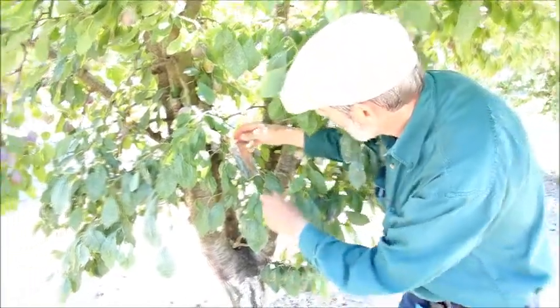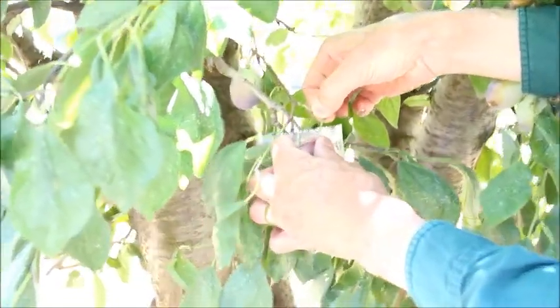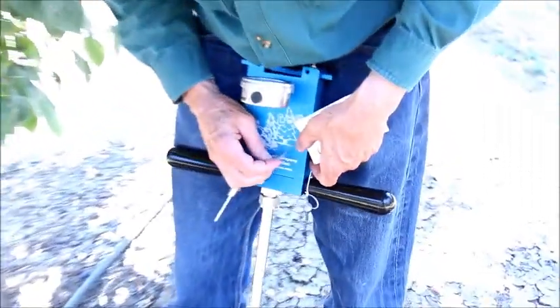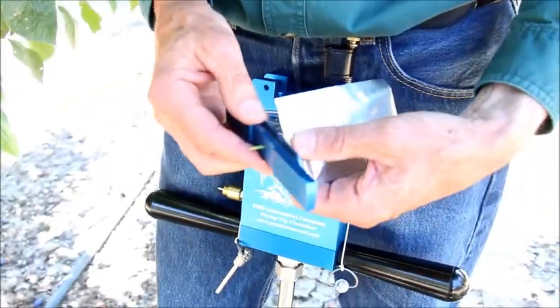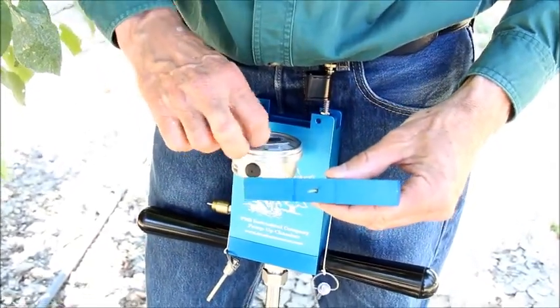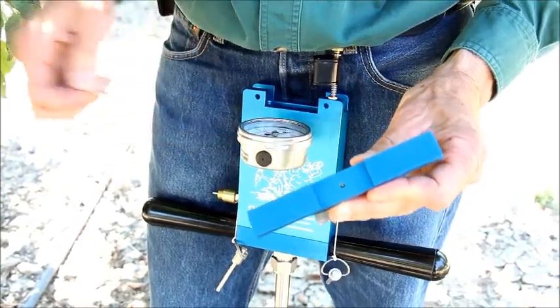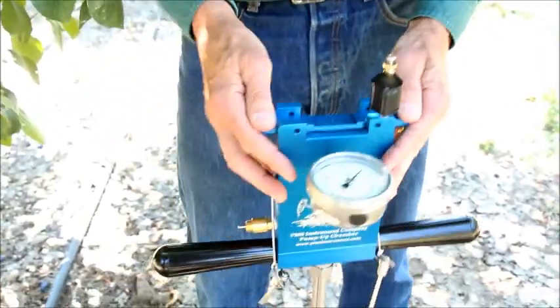I'm going to sample this leaf now by simply pulling it back off the stem — every leaf has a little nap to it so it comes off easily when you pull it backwards. Then I'm going to pull out the petiole a little bit and take this razor blade and cut it to a nice point so that it fits through the seal very easily. Tighten it down real good, then take the razor blade carefully — don't cut yourself — and slice it off nice and flush with that surface. Then you're ready to put it into the chamber.